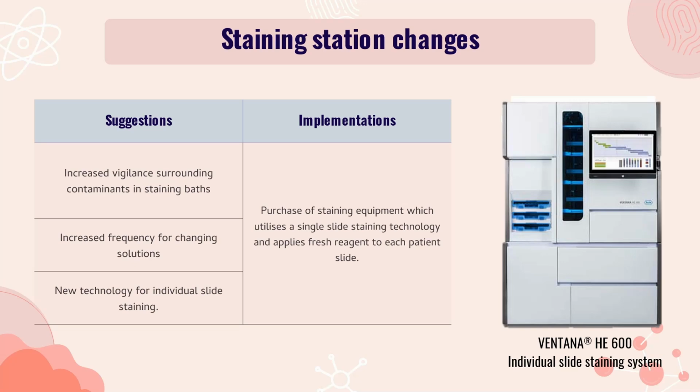At the staining station, the most important change was the purchase of a machine which utilizes a single slide staining technology, such as the one seen on the right. This stainer applies a fresh reagent to each patient's slide, eliminating the risk of transfer of tissue between cases during staining.